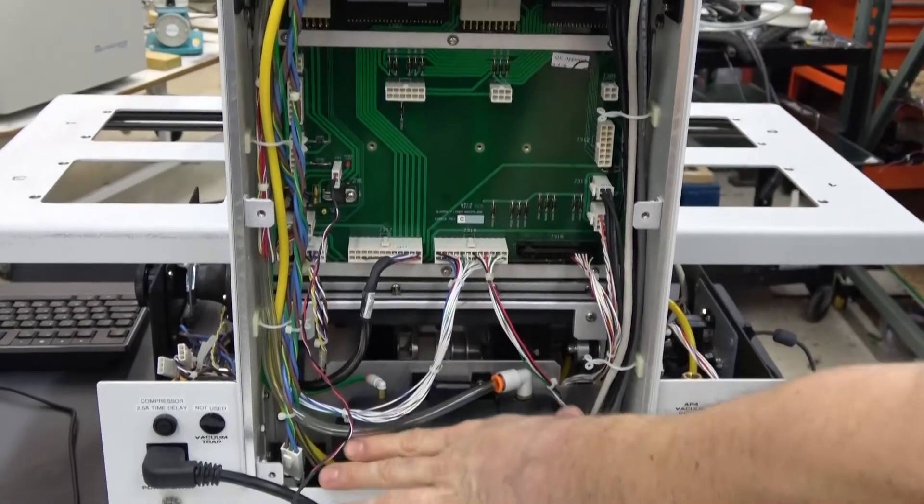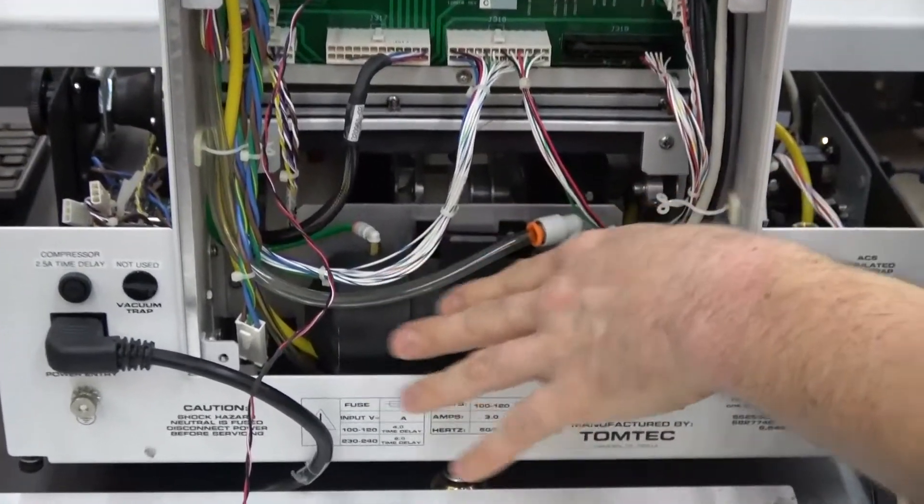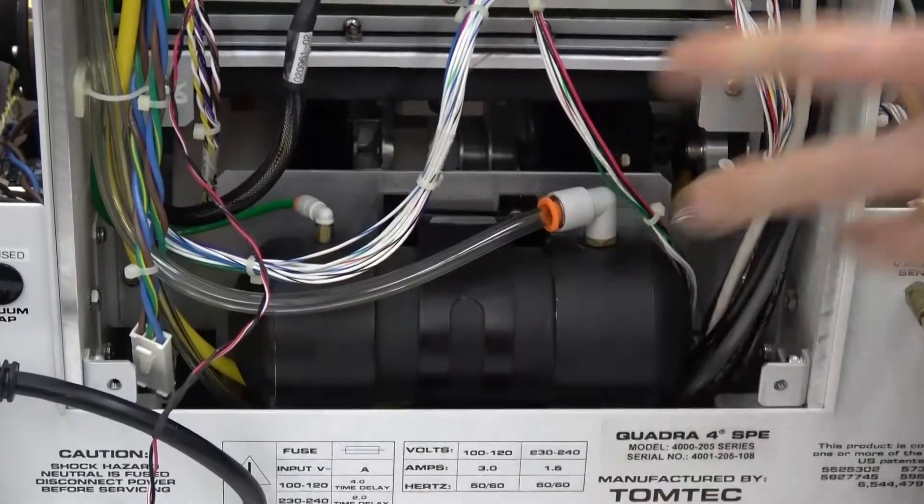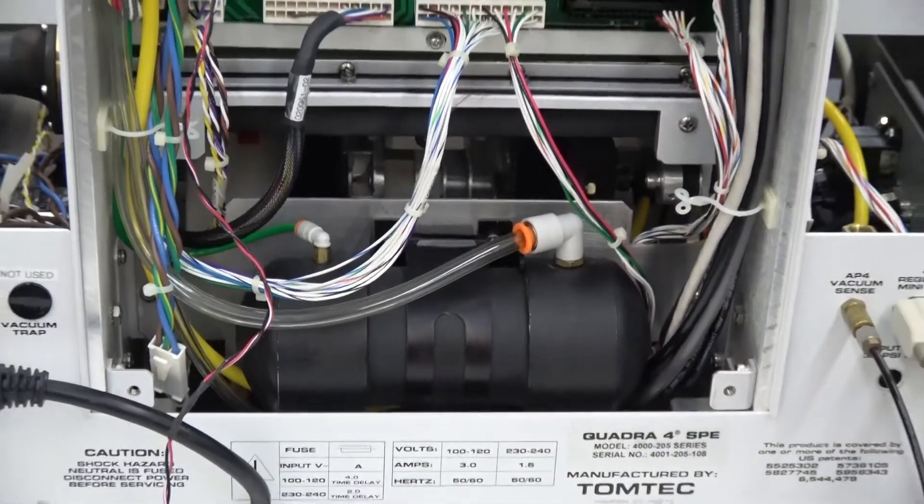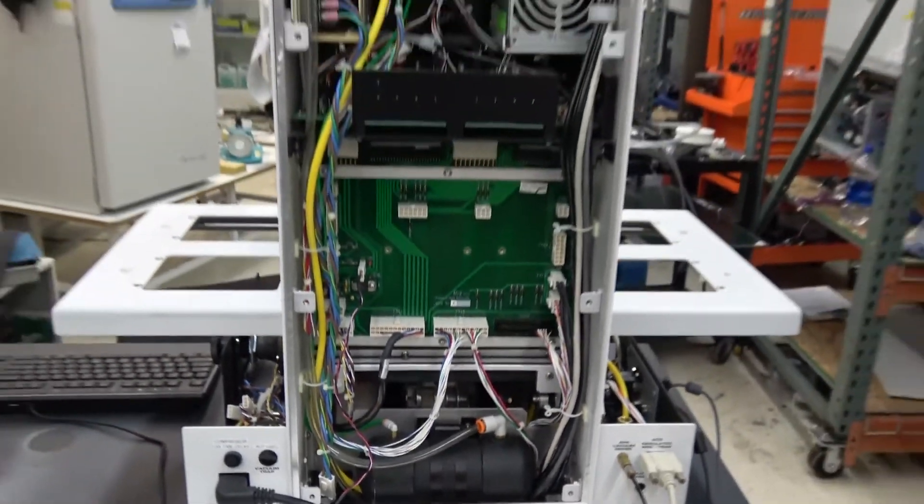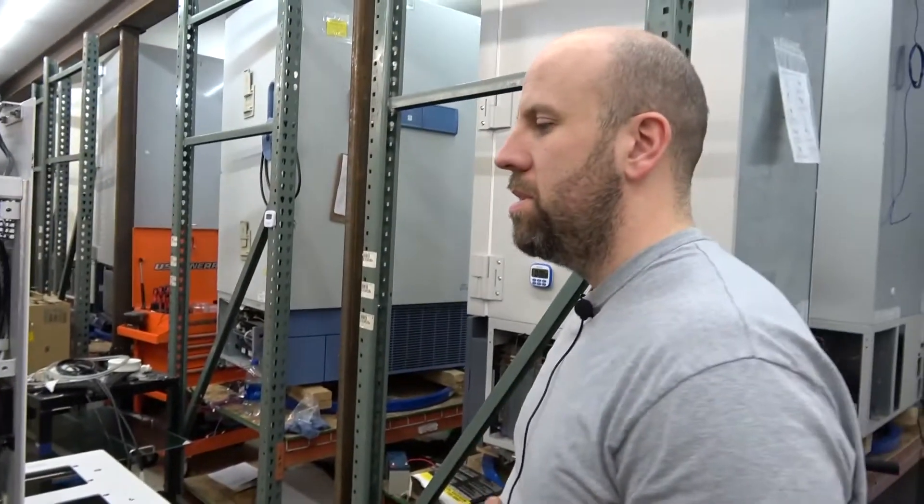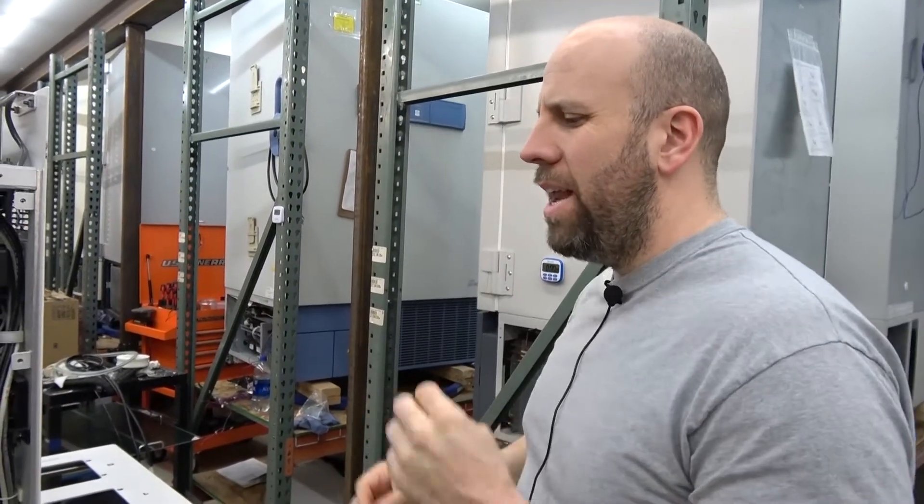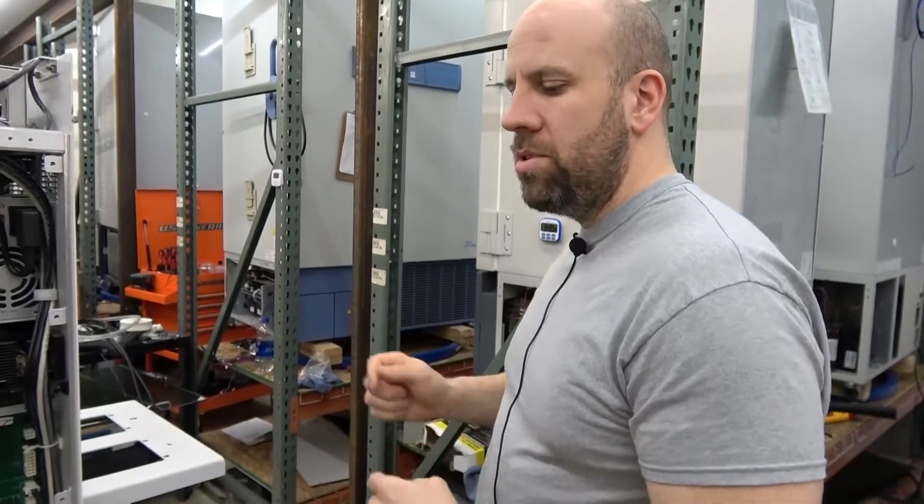This is a little air tank for building up enough air pressure to do the functions it needs. It uses air pressure to shuck the tips and blow them out. You can also aerate your samples with it.